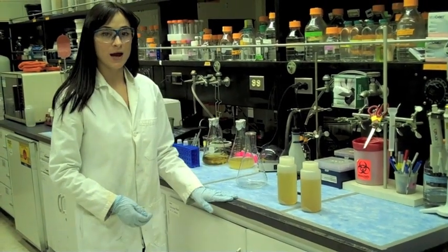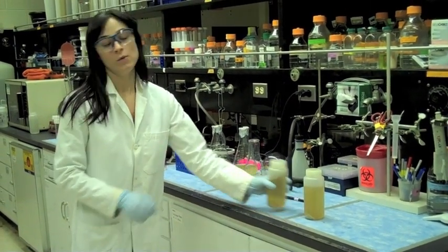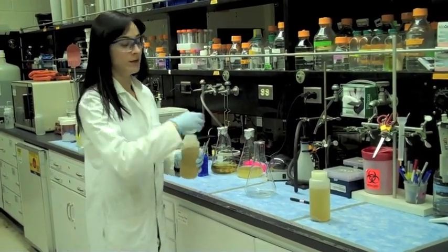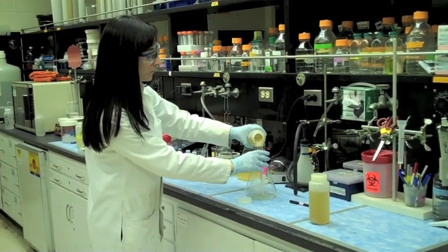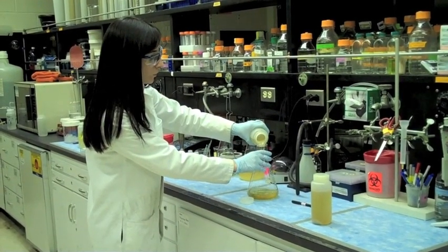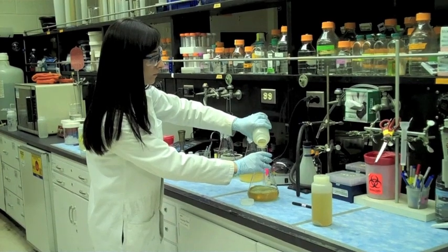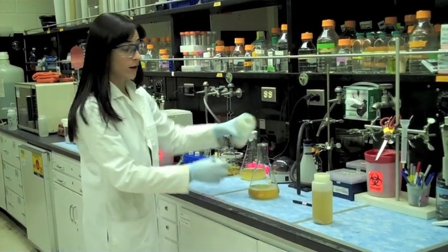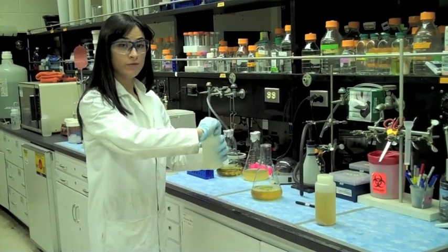In order to separate the bacteria from the liquid medium, we simply have to pour the liquid medium into a separate container. After we remove the excess media, we are going to break up the cells and prepare them for purification.